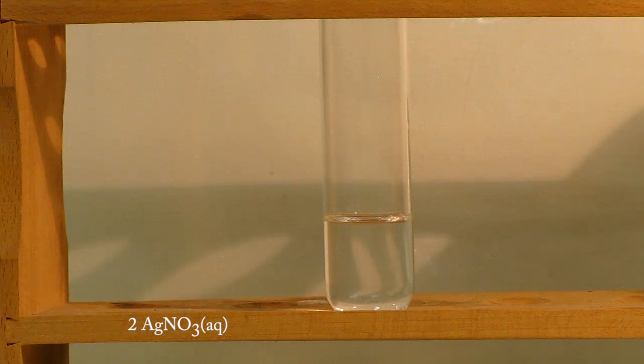And Melissa, since she's right-handed, is going to move to the other side and put a drop of sodium chromate in it.